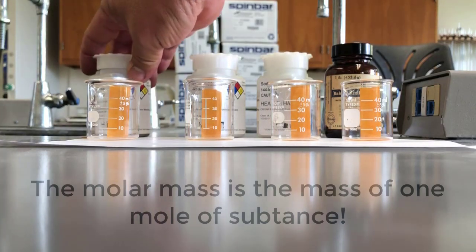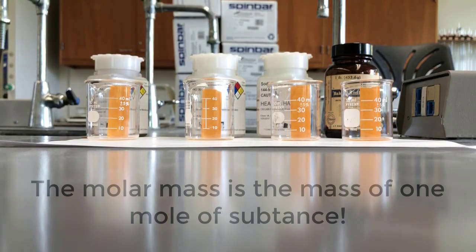So what I've done is I've lined them up and I try to make it so you can see the numbers in general, so you can do a comparison. After I put the mole of material in each beaker, your job will be, I'll zoom in and your job will be to estimate the volume and also to sketch the relative amounts. So this view that you're going to get at the end will help you draw the sketch with the relative amounts of material. I'll try to remove some of the distracting material in the background so that you can see it a little bit better.